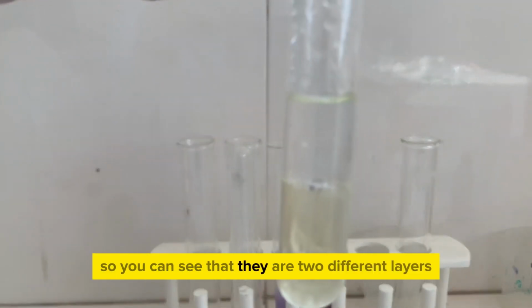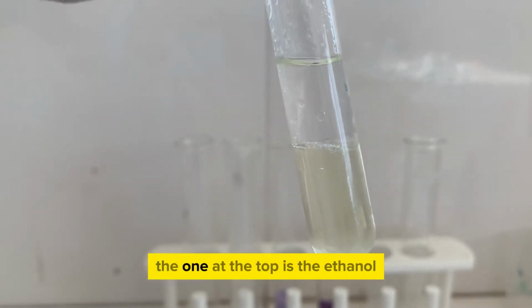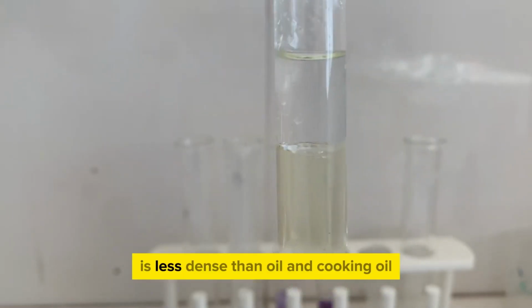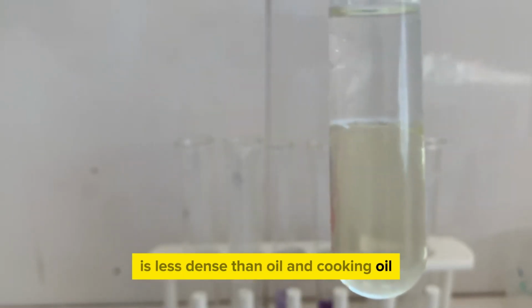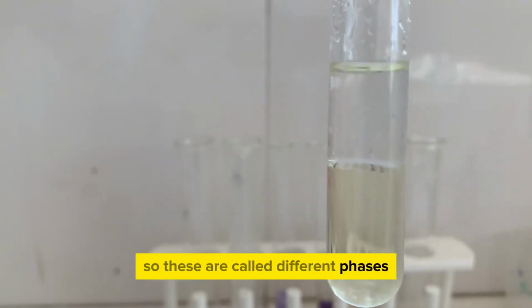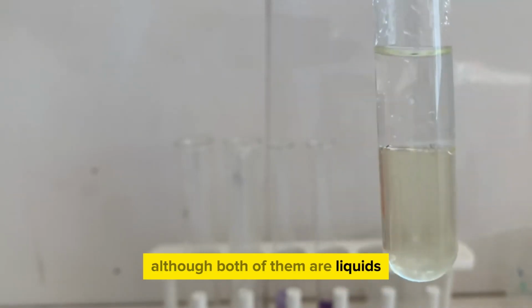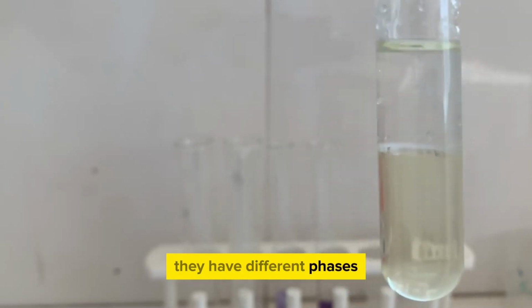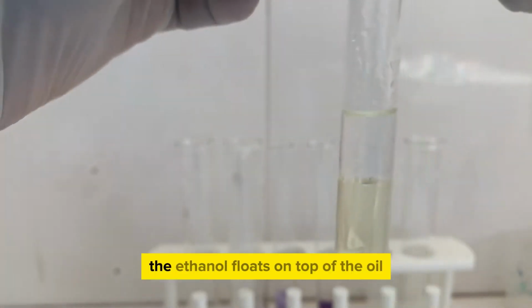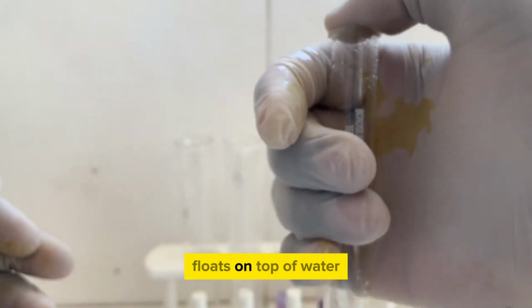So you can see here that there are 2 different layers. The one at the bottom is the oil, the one at the top is the ethanol. This is because ethanol is less dense than cooking oil, and hence it is on the top. So these are called different phases of the liquid state. Although both of them are liquids, they have different phases. One is less dense than the other, so it floats. The ethanol floats on top of the oil. You may have noticed this, that oil also floats on top of water.